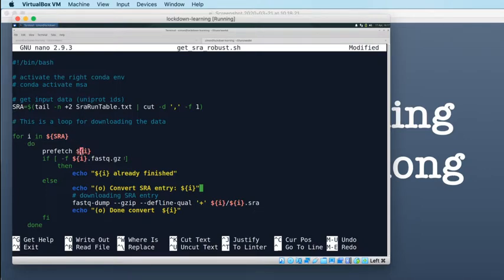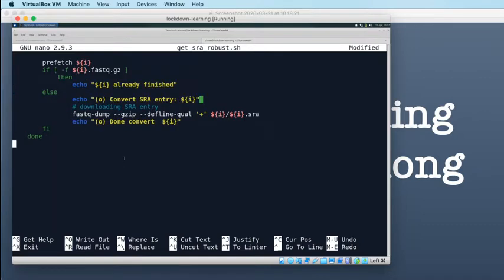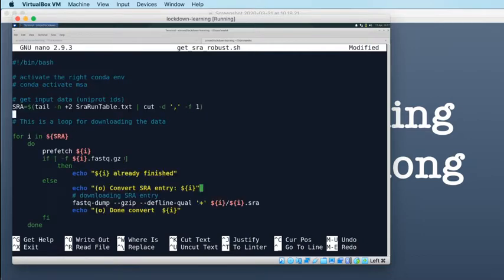So Prefetch downloads the SRA file from the SRA, puts it into a directory with the name of the SRA accession, and then the file inside that SRA accession directory is the SRA accession again, .sra. And then we're using FastQ dump to convert that SRA entry from the SRA format into FastQ format. And that should be sufficient and should be more robust than FastQ dump for the accession itself.